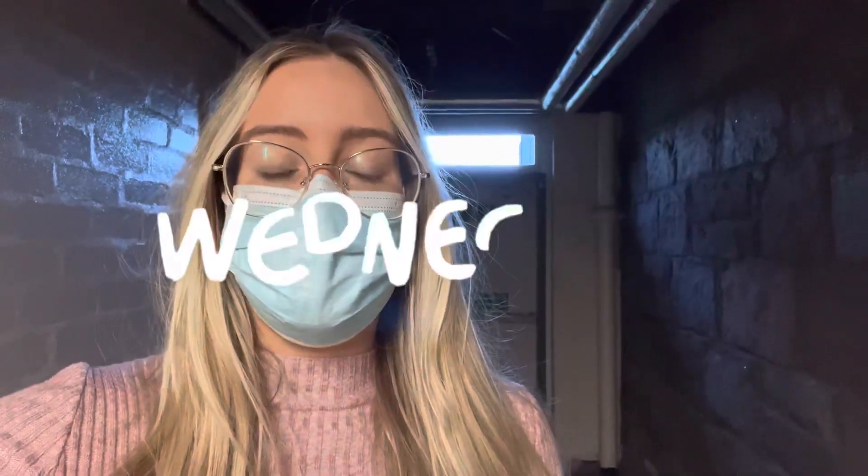Hello, good morning, happy Wednesday! I cannot run my bioassay this week because I forgot to autoclave tips. This week is going really well, as you can see. In a way it's good because it means a less busy day today - I'm very tired as I didn't sleep well last night after the pub quiz. I'm thankful for a less busy day and I can try to get some writing done. It's not the end of the world; I'll have more samples to test next week. It's annoying because my plan changed and I made a mistake, but I need to go autoclave some tips and media for next week.